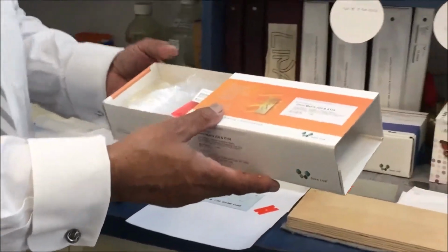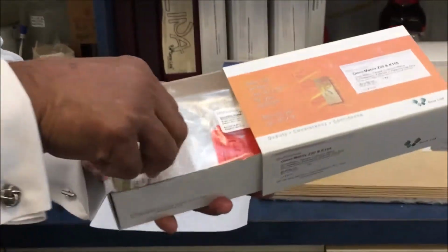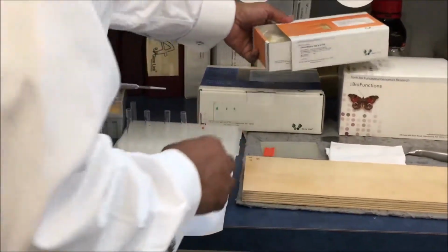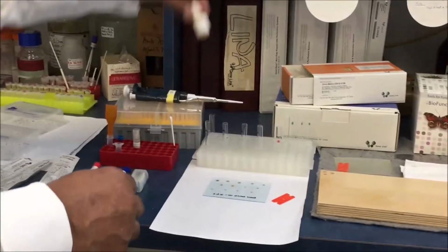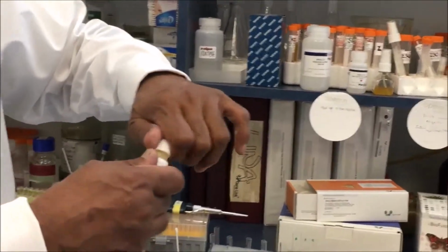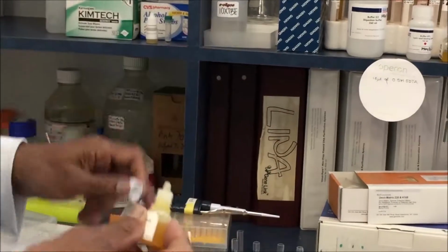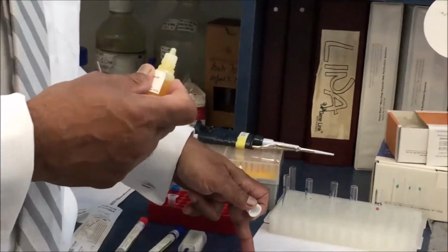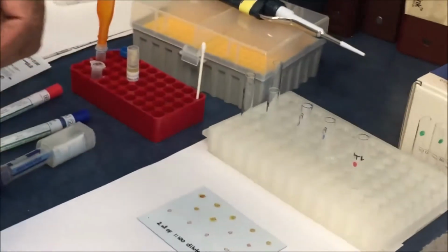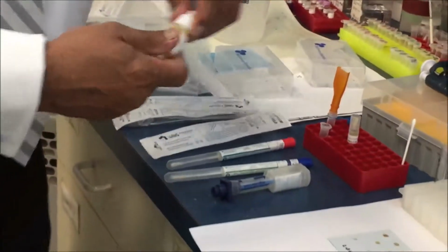It is manufactured by Biofunctions, and in the kit, you will see, and we have it already outside, a dropper bottle with the Omni-Matrix inside. The concept is, if the sample type is visible, you just go and apply a drop on the sample.